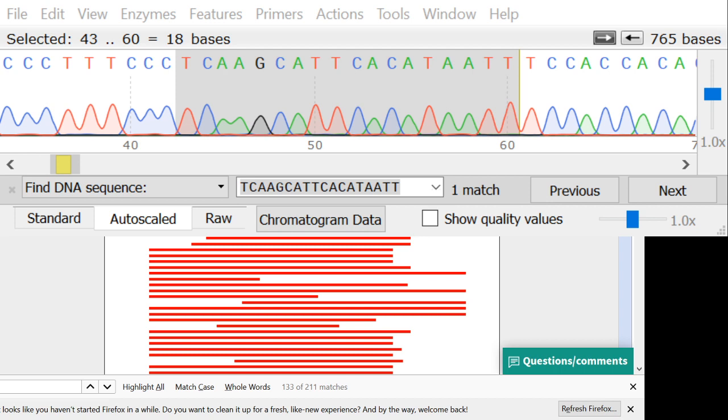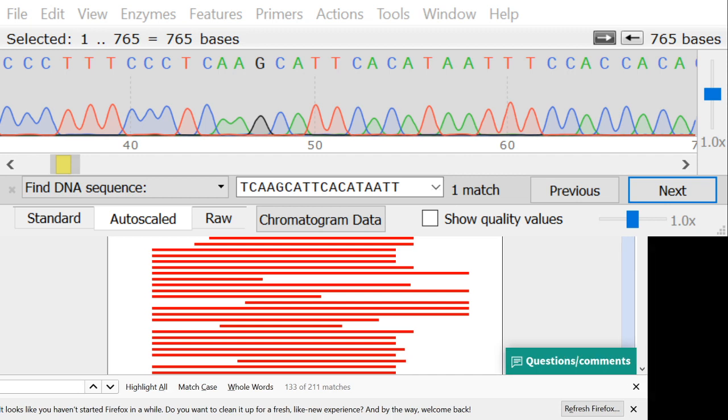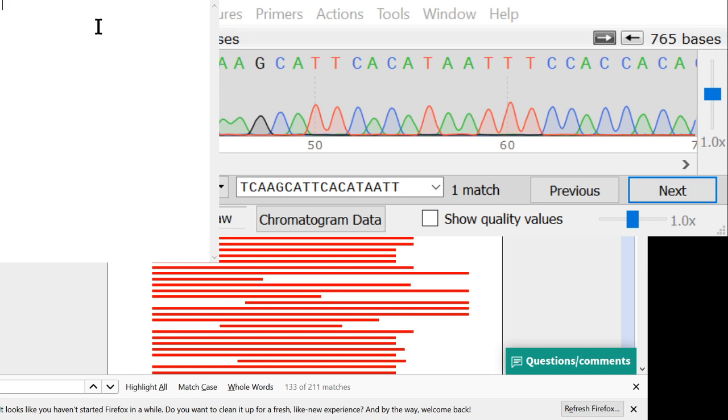To do that, we need to have our data in a FASTA file. So I will go back to our chromatogram, select all, and copy that to the clipboard. Now I'll open up a notepad, and I will add the notepad to the sharing so you guys can see my notepad. There it is. Okay, now you can see my notepad. What we're going to do now is make a FASTA, because GenBank wants to see the sequence in FASTA format. FASTA is cool because it's very easy and it's human readable.